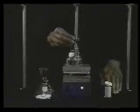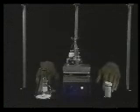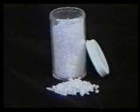In the second step of this technique, you dissolve the solid sample in the suitable solvent. You will need an Erlenmeyer flask for the solvent and another to hold the crystals, a hot plate, some boiling stones, a dispo pipette and bulb, and finger cots. Add 2 boiling stones to each flask. This is important because boiling stones contain air-filled pores which serve as sites for bubble formation. Bubble formation prevents a heated solvent or solution from bumping and leads to smooth boiling.